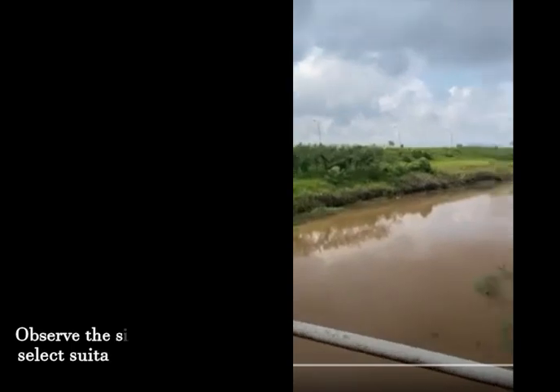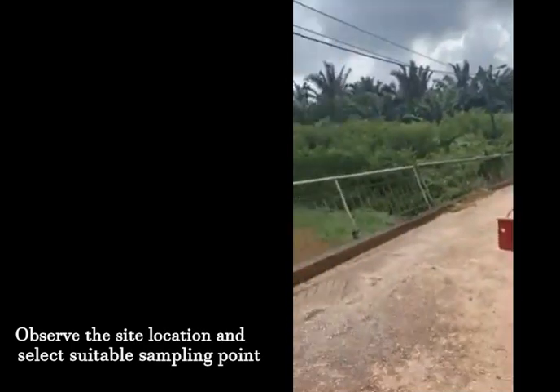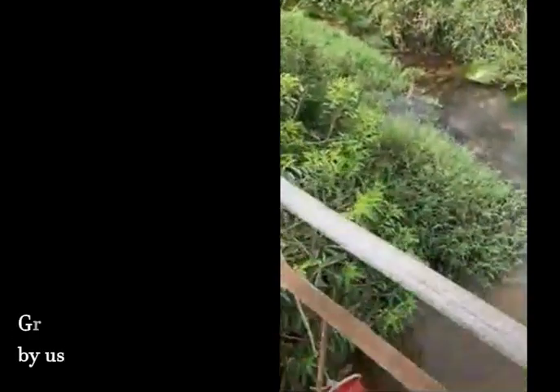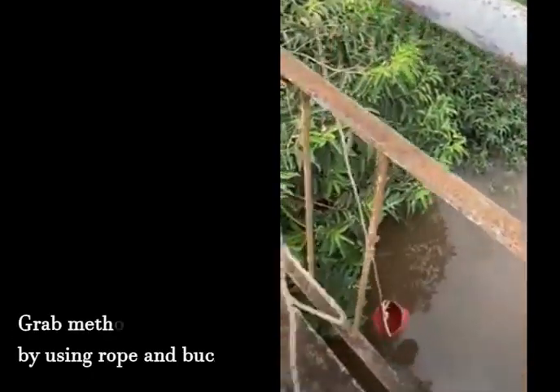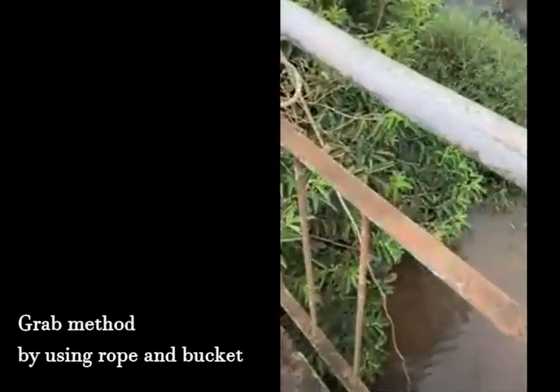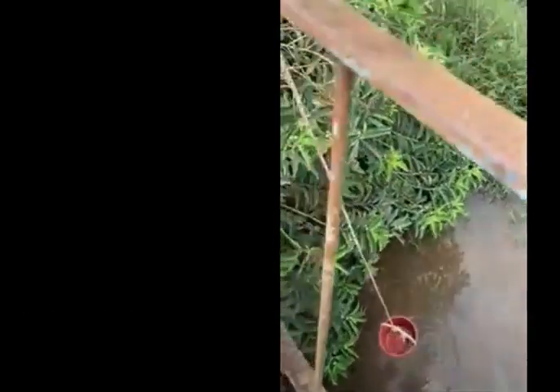At the sampling field, it is very important to observe the sampling location in order to find a suitable sampling point that is easy to access and safe from any hazards. In the sampling location, the grab method using rope and bucket was adopted due to limited access to the river, and sampling was conducted at the high bridge.